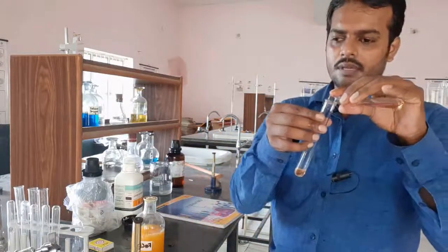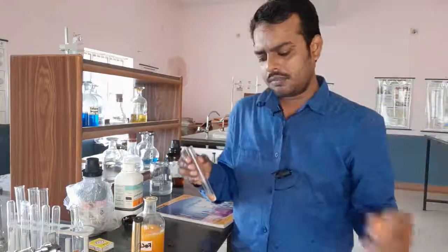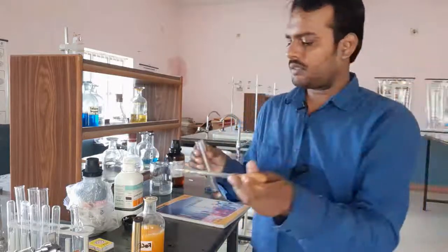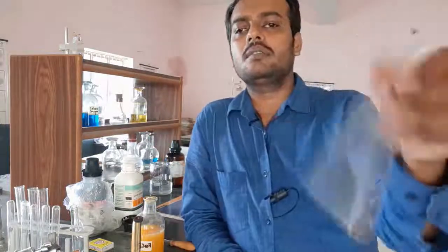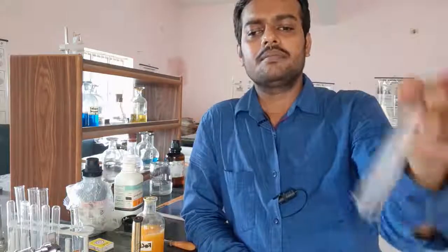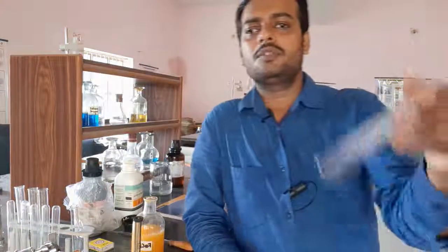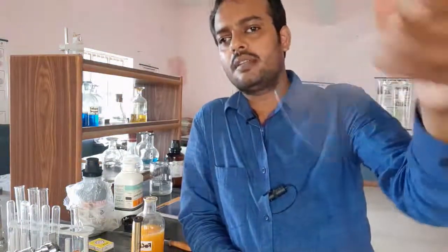We have taken a small quantity of sample, and to this we will add a small quantity of FeCl₃ solution. Let us see what happens — adding just a few drops. You can see it has given a violet coloration. The violet color appears more clearly in aqueous solution, so we are adding a small quantity of water. You can see the clear violet color.